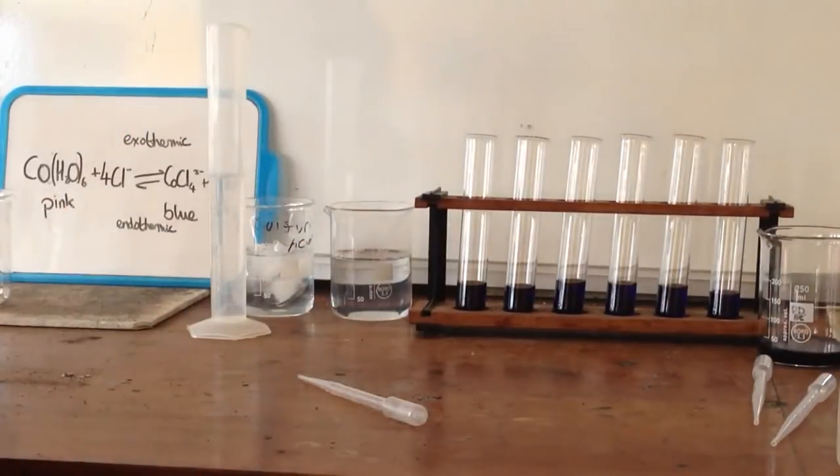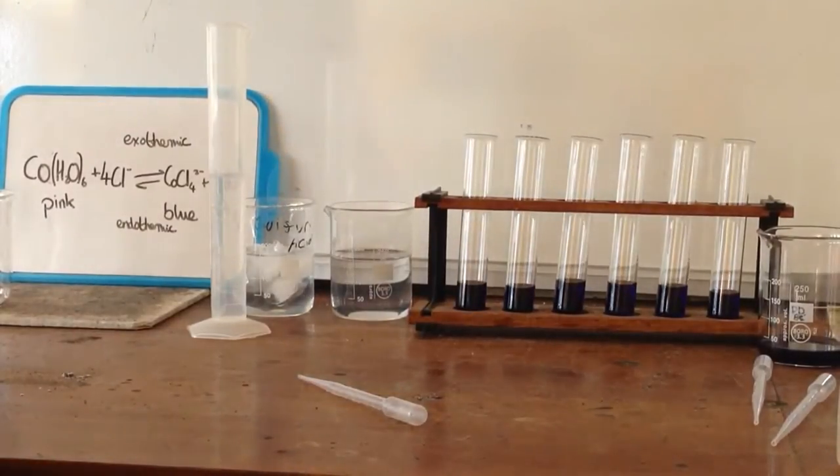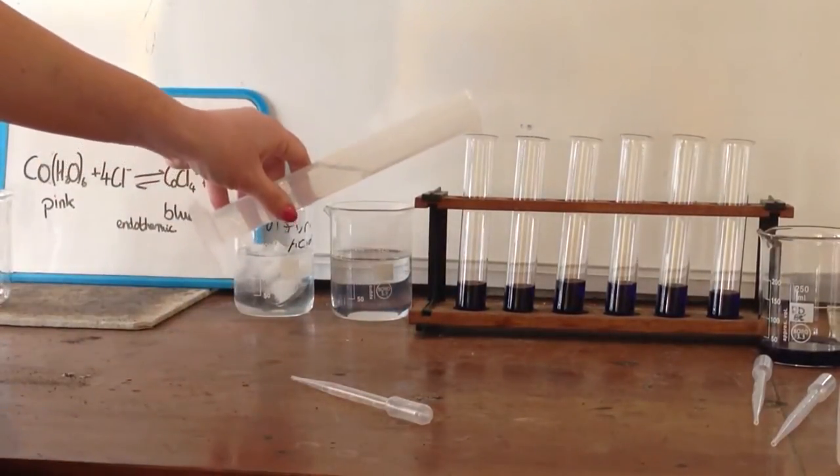So I'm going to keep this one in the middle here as a control whenever we do the experiments, and then I'm going to alter the ones on either side. So this one here I'm going to add hydrochloric acid to.